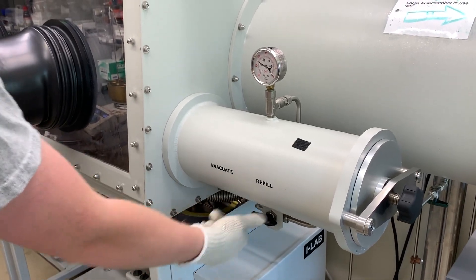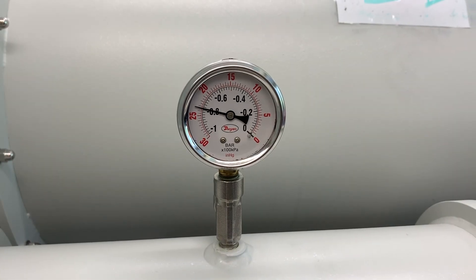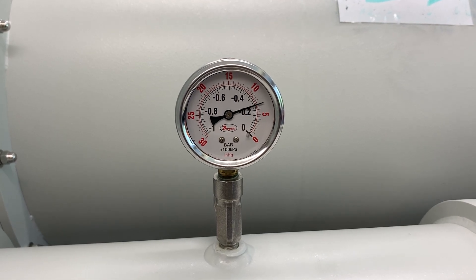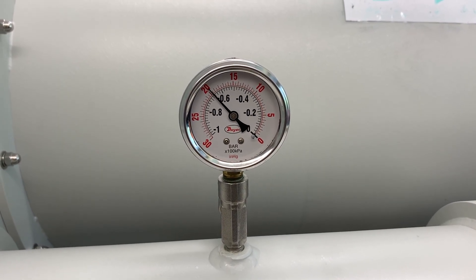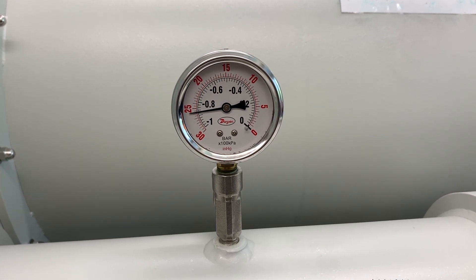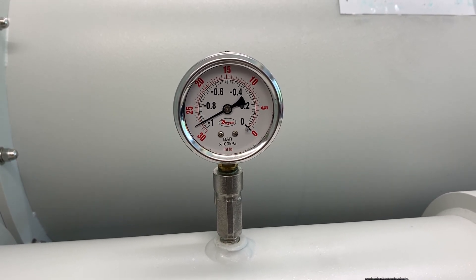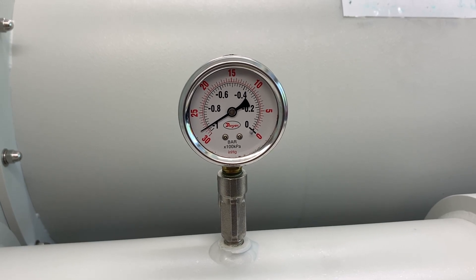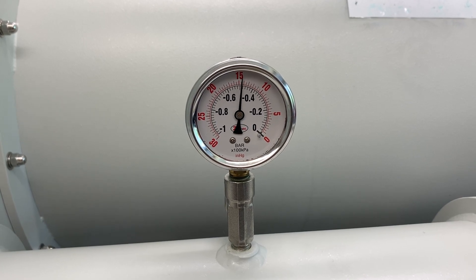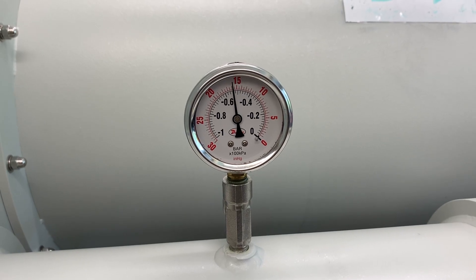After five minutes are up, you can refill the antechamber with fresh nitrogen gas and begin your second evacuation cycle. Here's another important point: notice the vacuum gauge as Nick does the refill — it never reached zero before turning it back to vacuum. The air inside the antechamber still contains some humidity and oxygen that could pollute the glove box's atmosphere. Nick isn't letting the pressure equalize between the two spaces, so the net movement of gas is actually toward the antechamber, preventing any bad air from making its way back into the glove box. Your goal is to perform three of these evacuation and refill cycles. Once that's done, you can open the door and bring in your stuff.